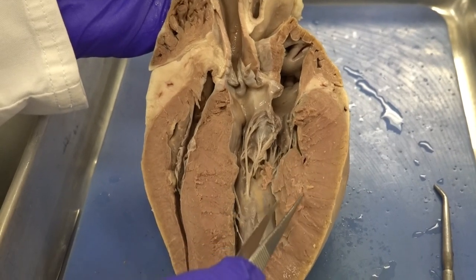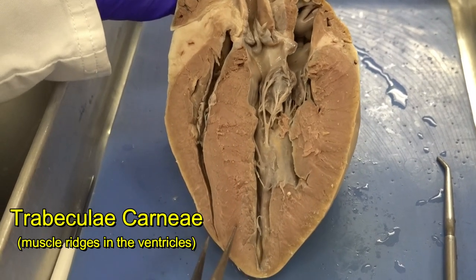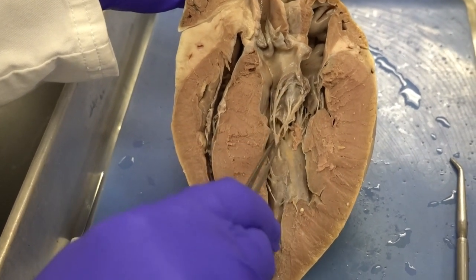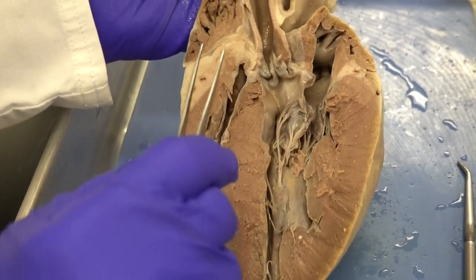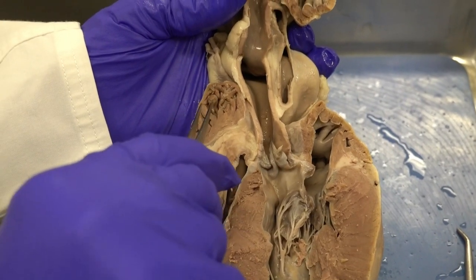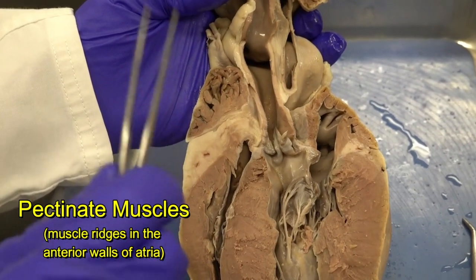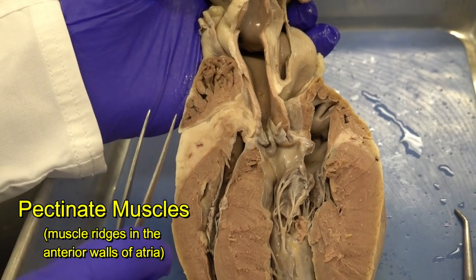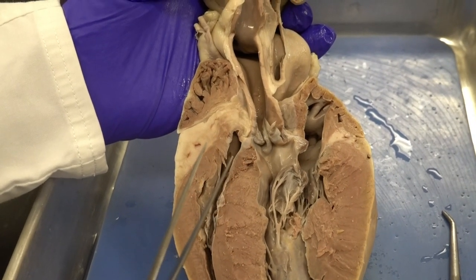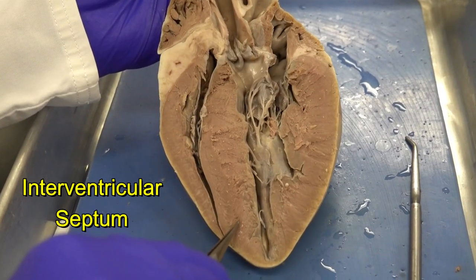Inside the ventricles, all the muscle ridges — whether short or tall — are named trabeculae carneae. The taller ones connected to the cusps of the AV valves via chordae tendineae are the papillary muscles. In the wall of the atria, I also notice muscle ridges — these are called pectinate muscles. The pectinate muscles contract during atrial systole as part of the general atrial wall contraction.